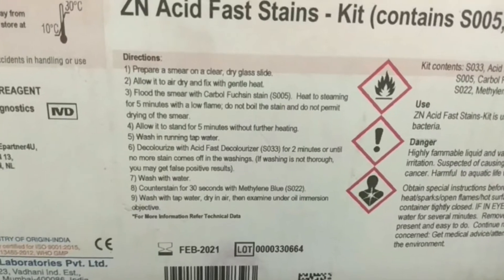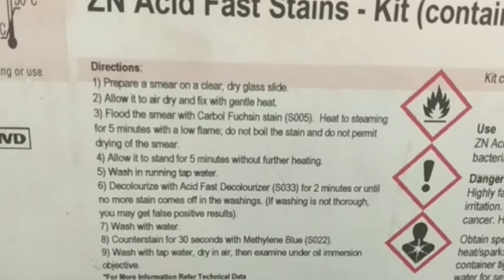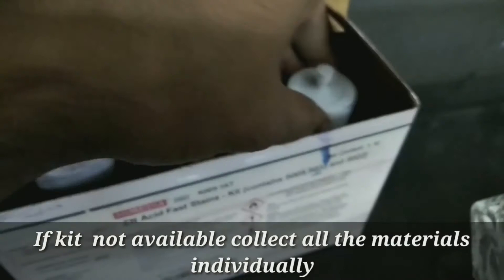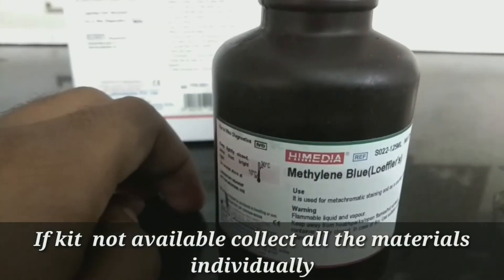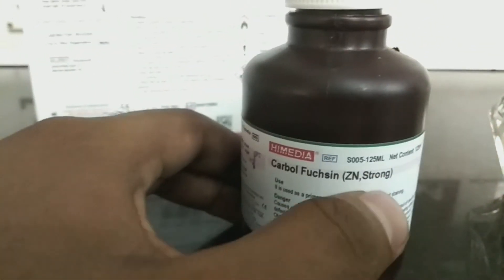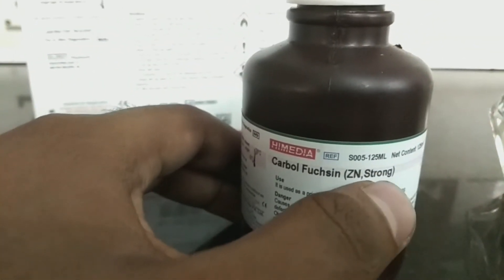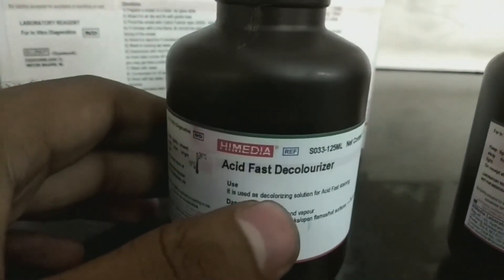For acid fast staining we require a Ziehl-Neelsen acid fast staining kit, which contains three reagent bottles. First is methylene blue, which is the secondary or counter stain. Second is carbol fuchsin, which is the primary stain. Third is the acid fast decolorizer.